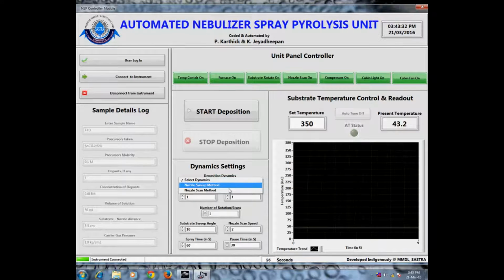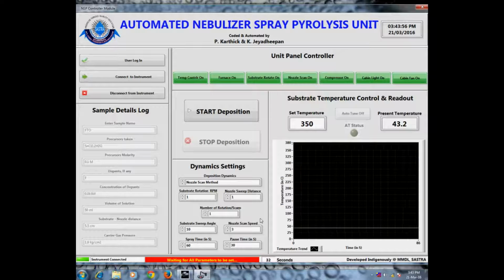The software is designed to have two different dynamic settings. One is the nozzle sweep method, in which the nozzle scans the substrate discretely and the substrate is rotating continuously. Another is the nozzle scan method, in which the nozzle scan is continuous and the substrate rotation is discrete. The deposition can also be done using the spray pass method. The desired dynamic settings and their parameters should be given before starting the deposition.